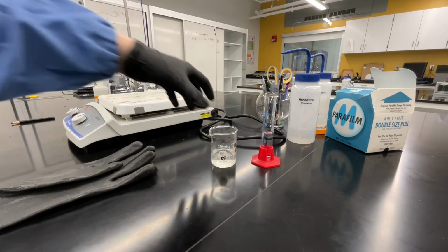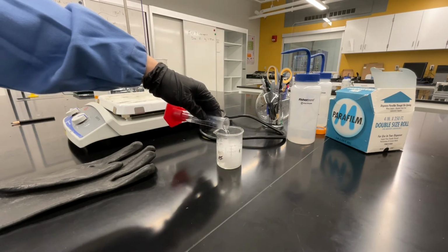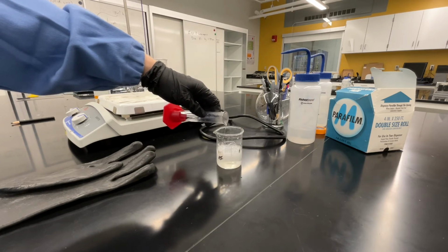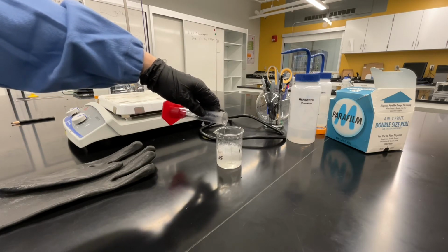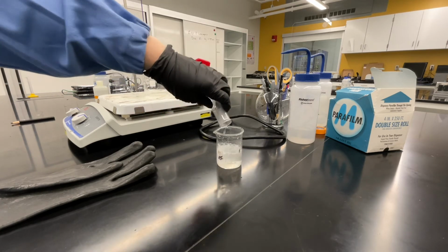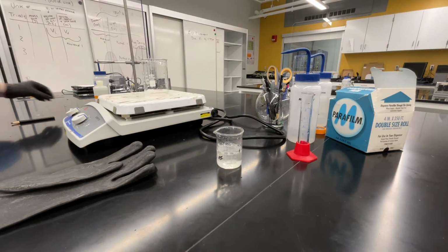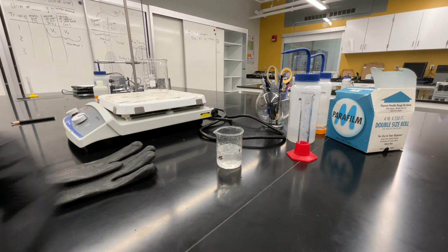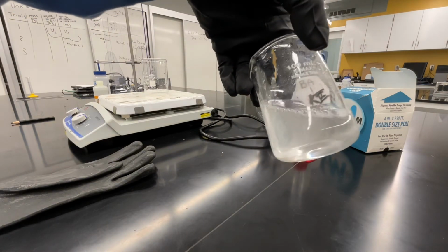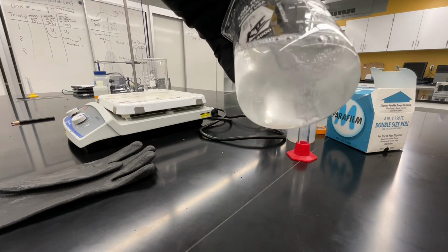Immediately after removing the beaker from the hot plate, slowly add your sodium carbonate to the solution. Do this very slowly. As you can see, this is going to cause a reaction. Record your observations as you slowly add your sodium carbonate. After you've added all 15 milliliters of the sodium carbonate, you may start to see a solid precipitate form in your reaction mixture. As this cools and stirs, we're going to see more and more of this solid precipitate form.